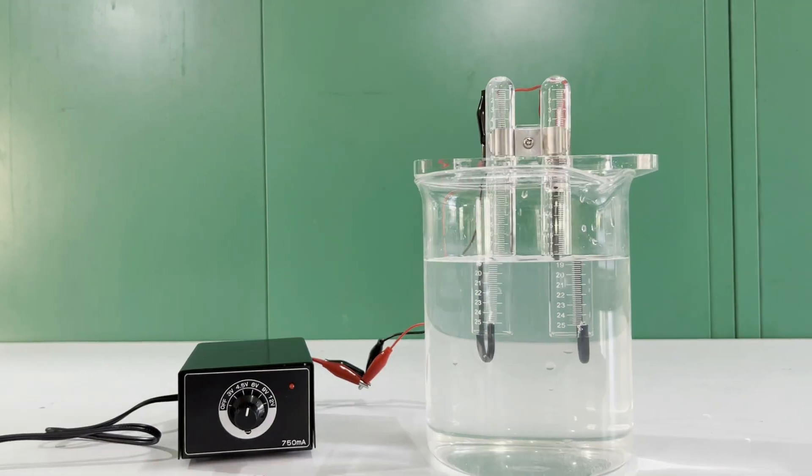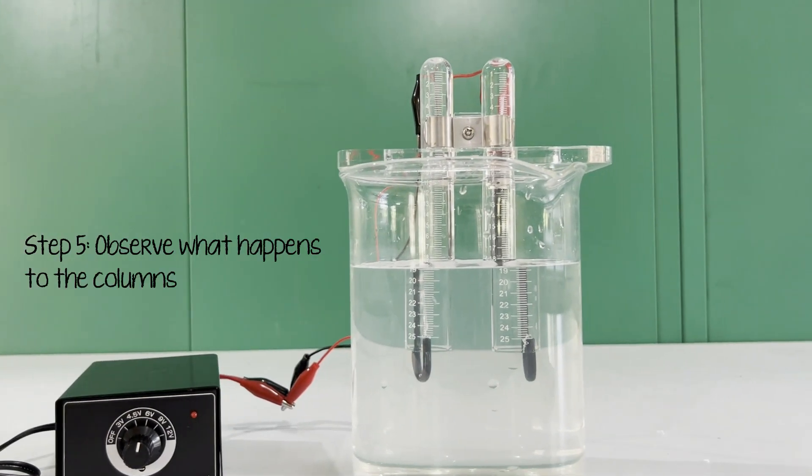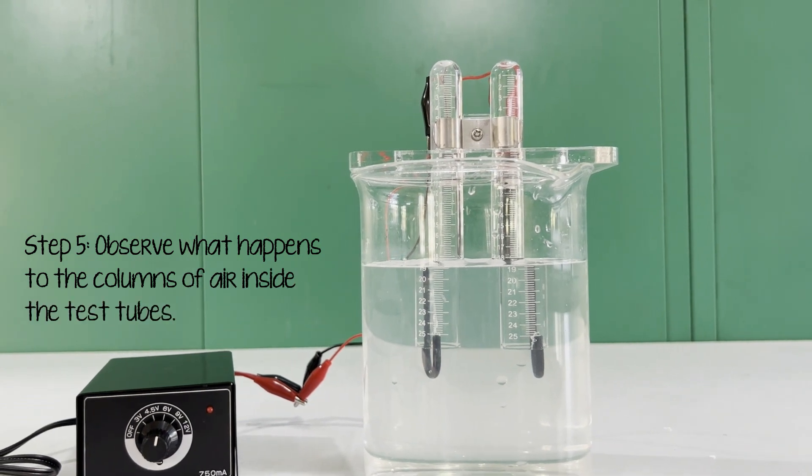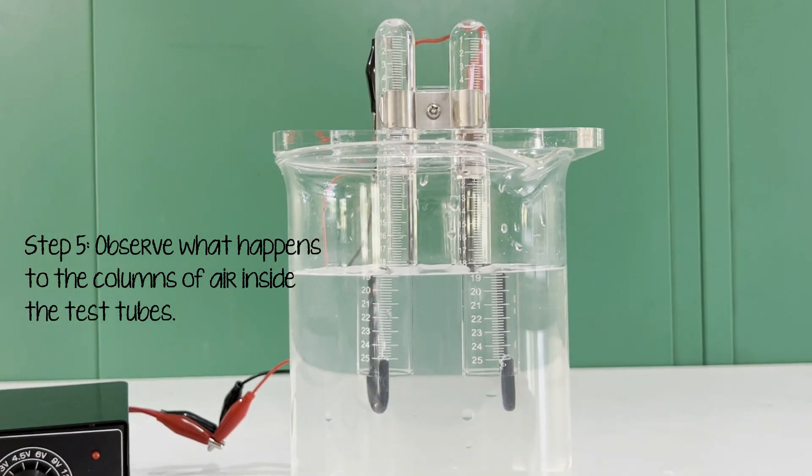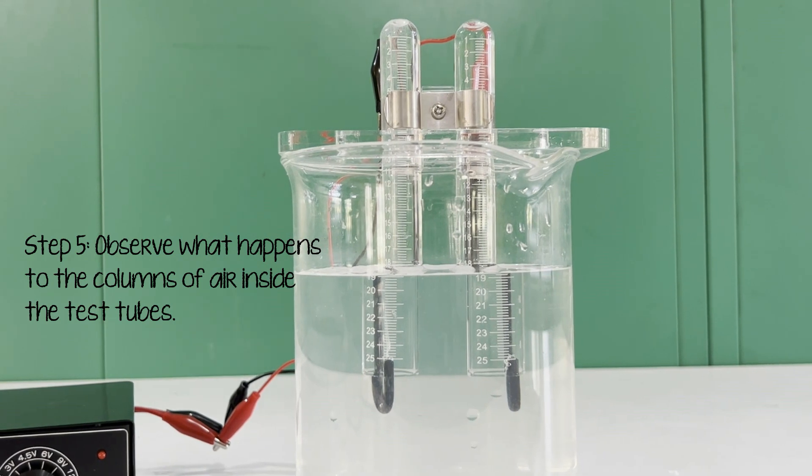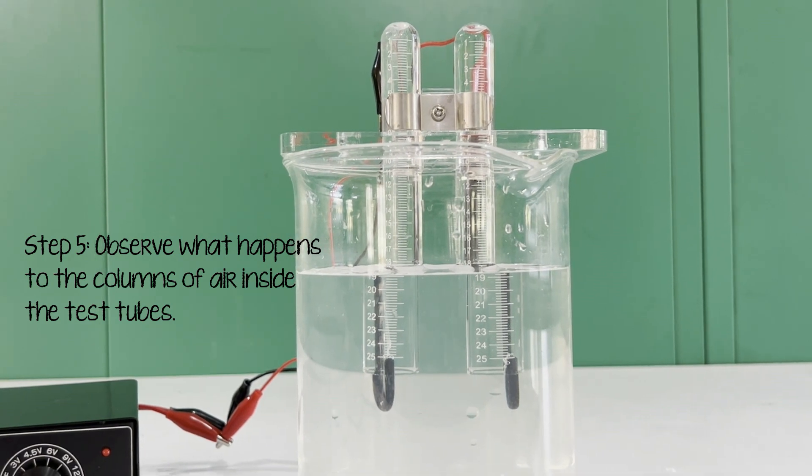Now, the waiting game starts. Observe what happens to the column of air inside the test tubes. I have sped up the videos because it took me more than an hour to observe a large column of air.